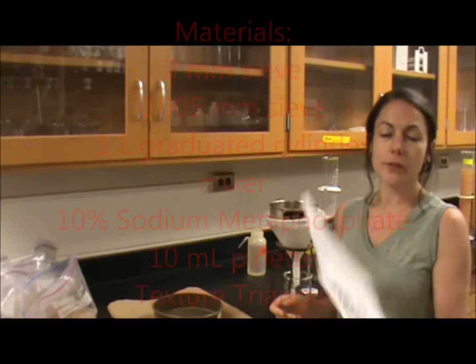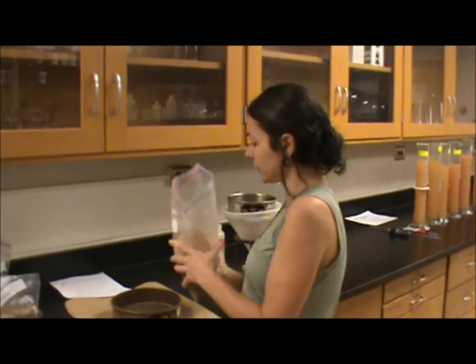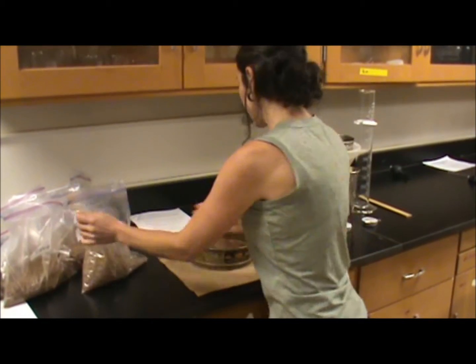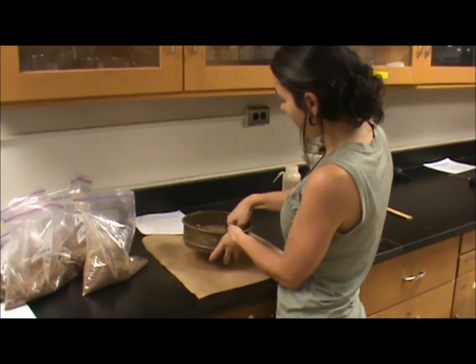For Lab 3, we're doing a particle size distribution with the samples that we took from the rain garden. For Lab 1, everybody took loose soil samples. So we're going to use this to determine the percent sand, silt, and clay. To start off, we're going to sieve our soil. We only need about 20 grams.